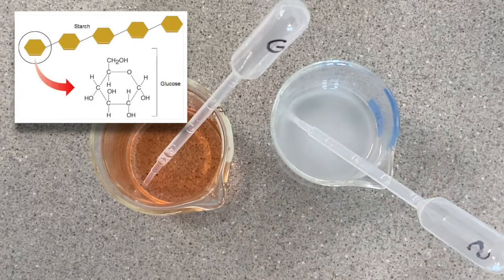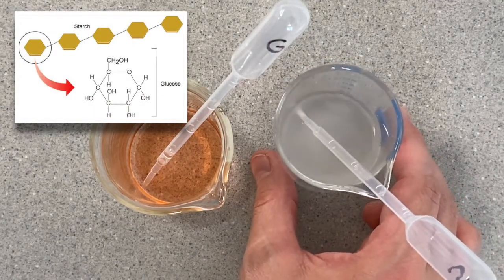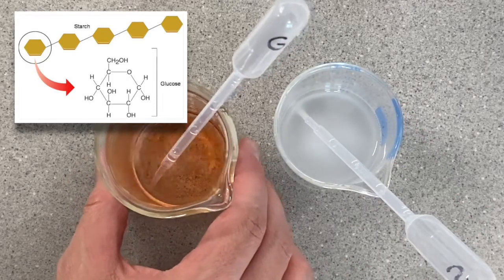Remember, glucose is a building block of starch, so the molecules in this solution are basically bigger versions of the molecules that are in this solution.